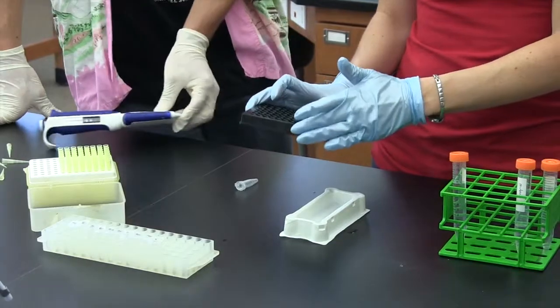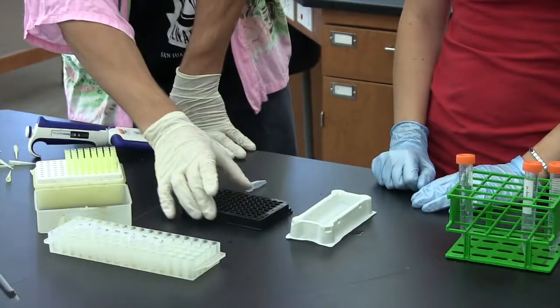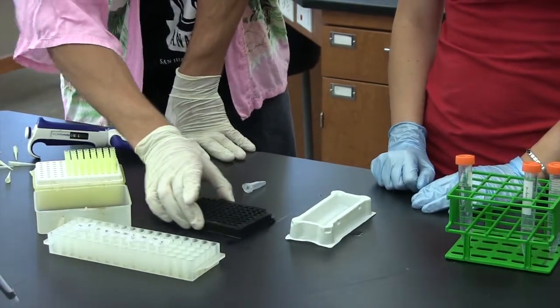And once you're done, you just have to tap it a little bit to mix it. And then you're ready to go. You want to shake in a T formation since it's circular.